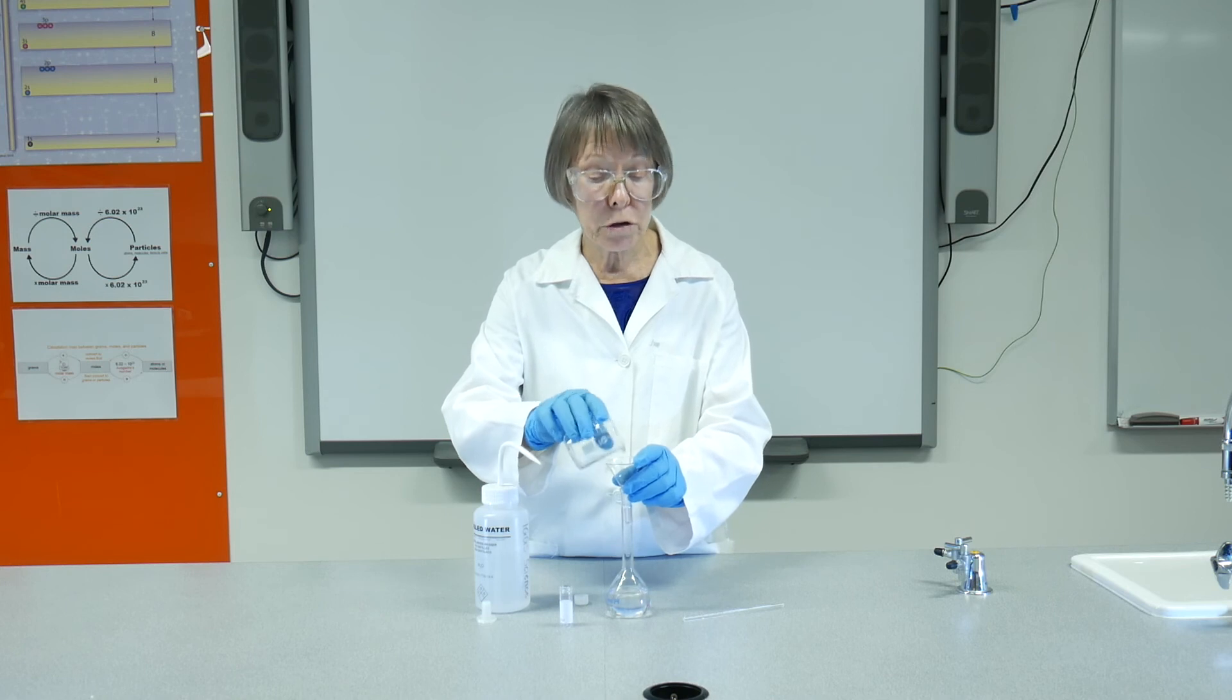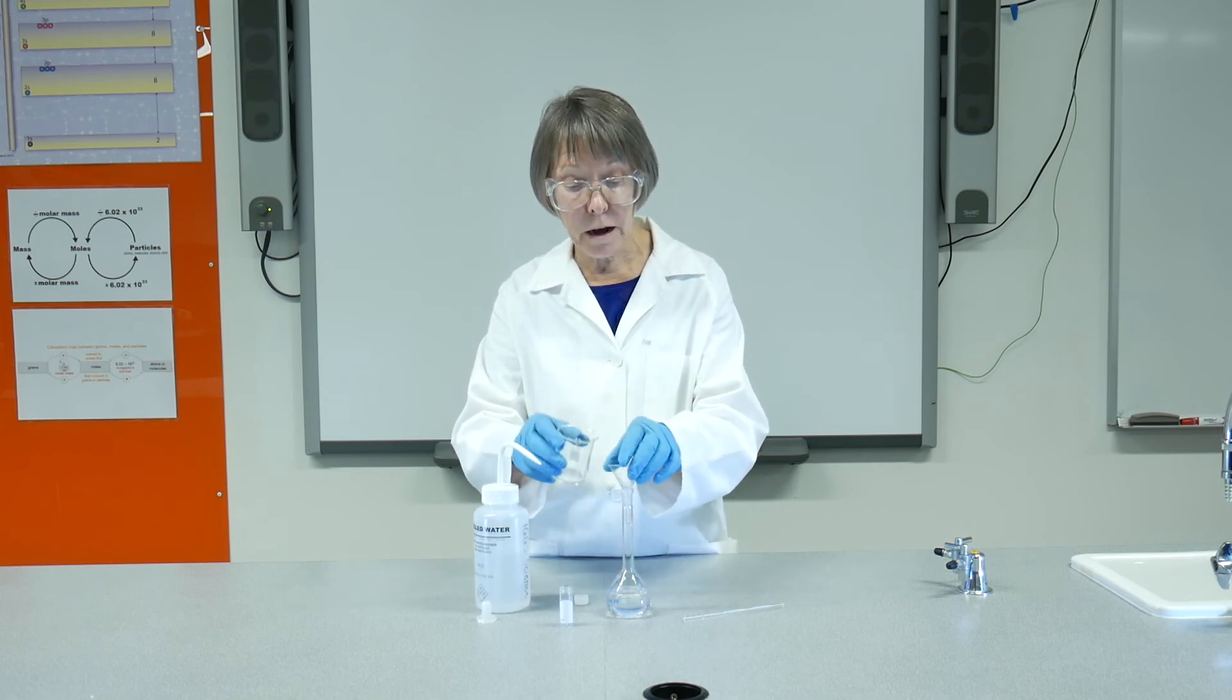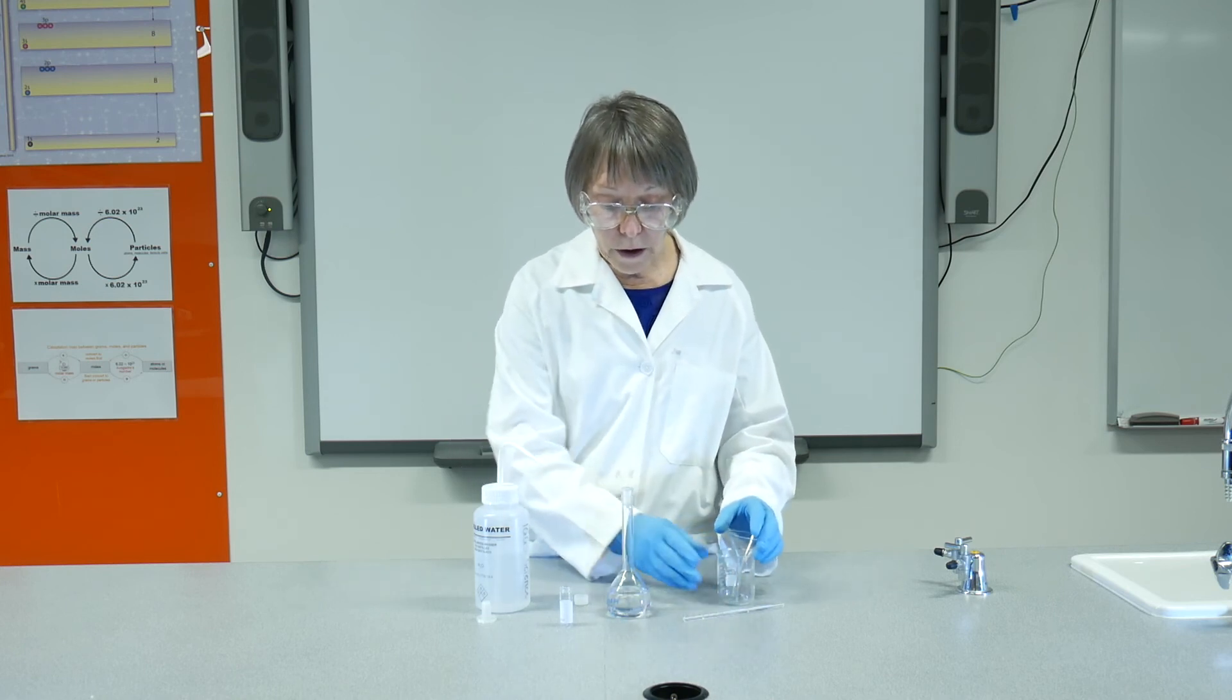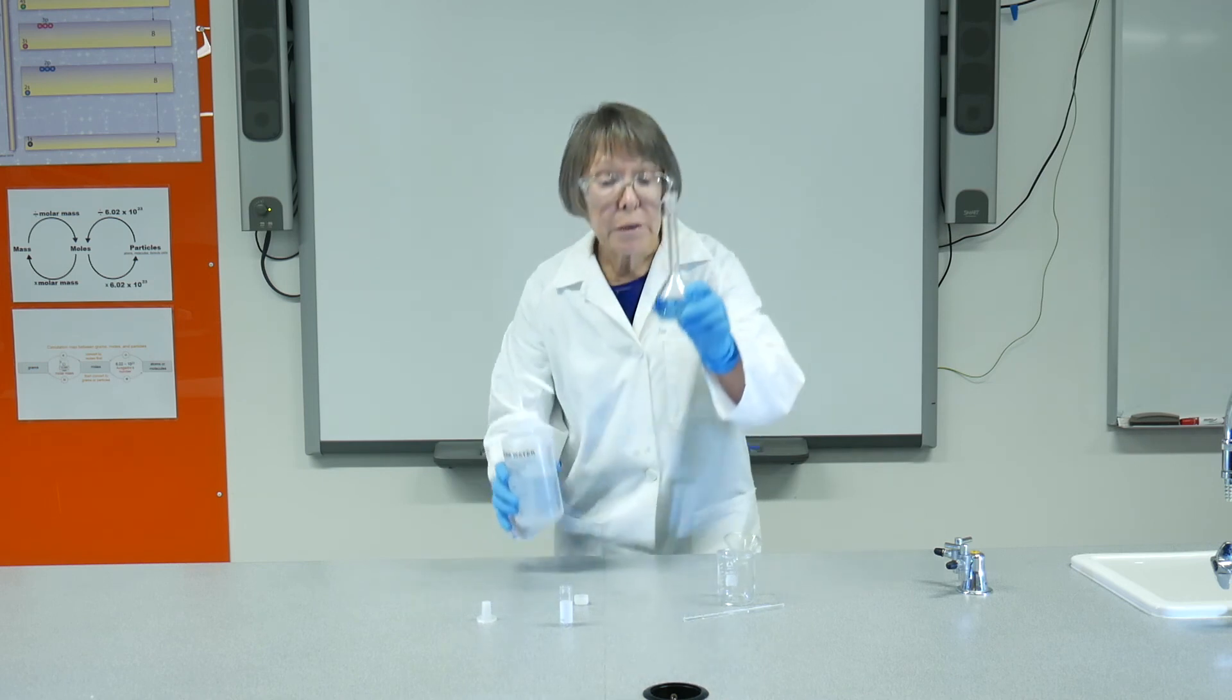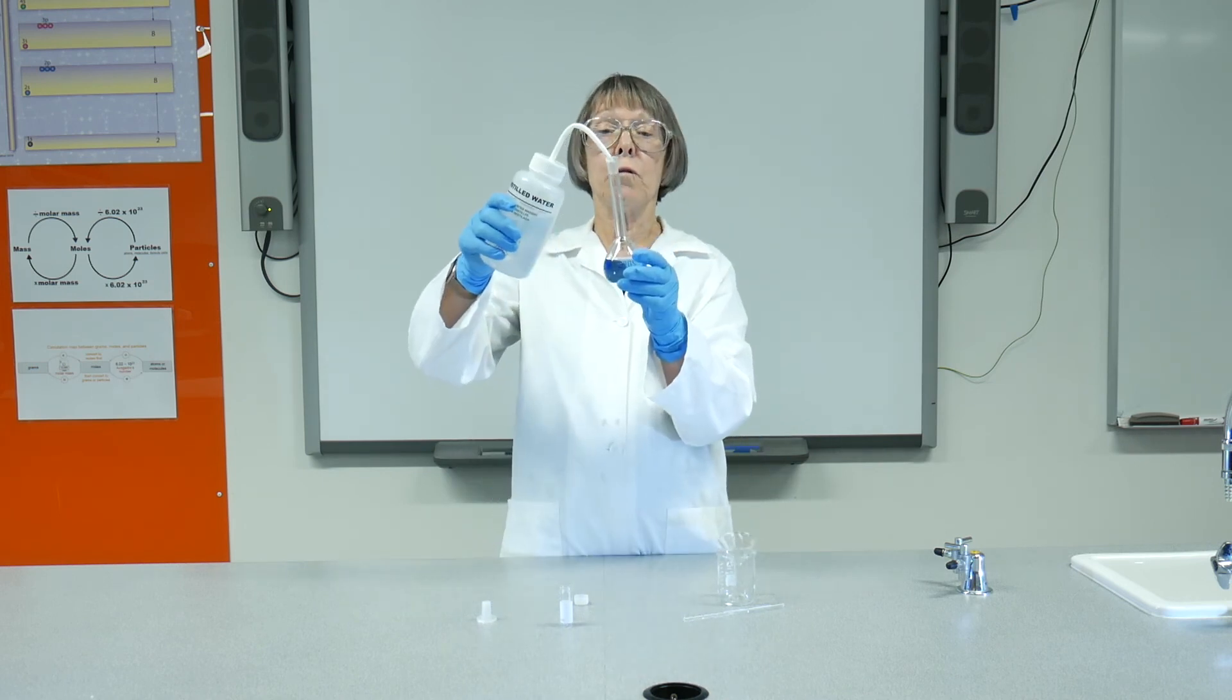Now when you're sure that you have rinsed all of the acid out of the beaker, you can then proceed to fill up to your mark.